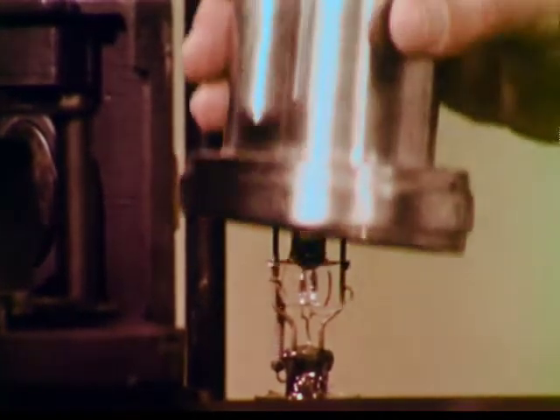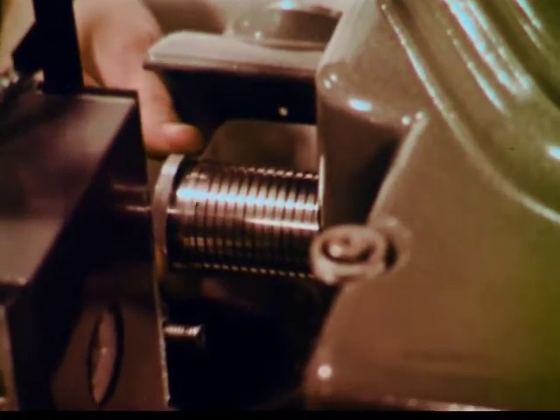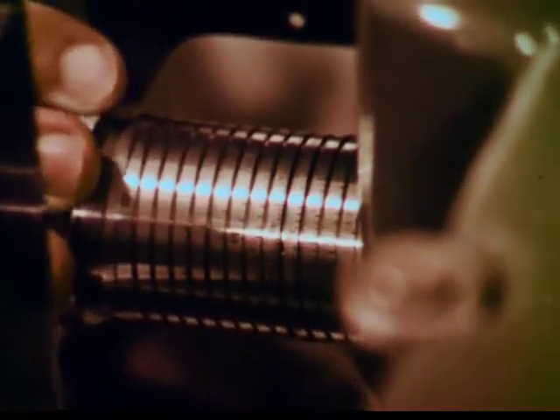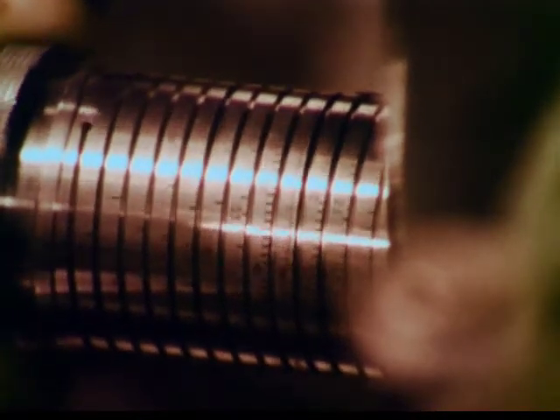Now let's cover the lamp, turn it on, and see how the instrument works. The light passes through the prism, which separates it into different colors. Each color of light has a characteristic frequency which determines the energy. The slit admits a particular frequency to the cell. Now we have placed the cover on the instrument. The micrometer head, which controls the quartz prism, allows us to select a single frequency or color to pass out through the slit and enter the cell.